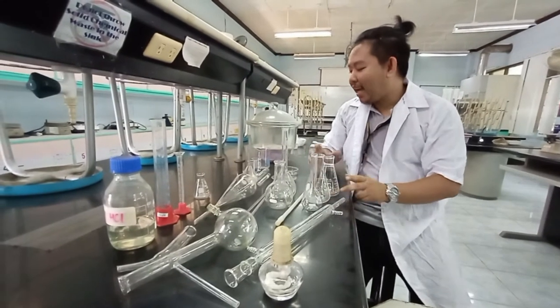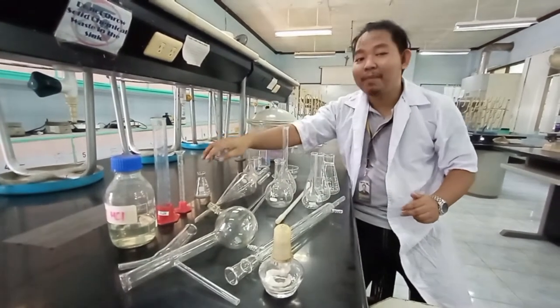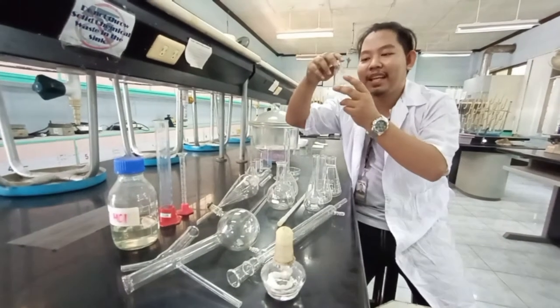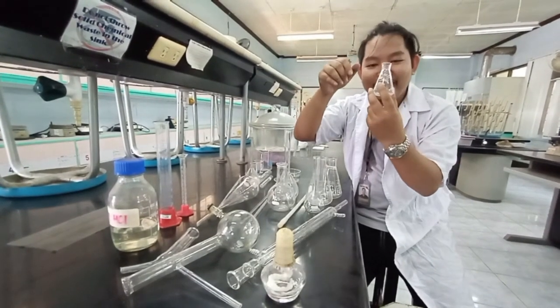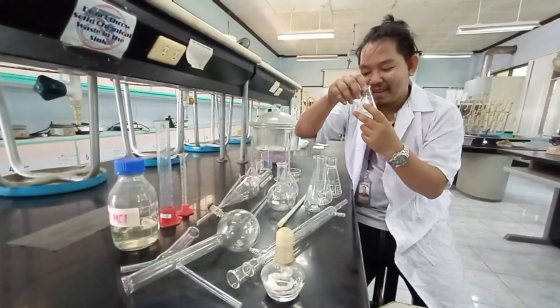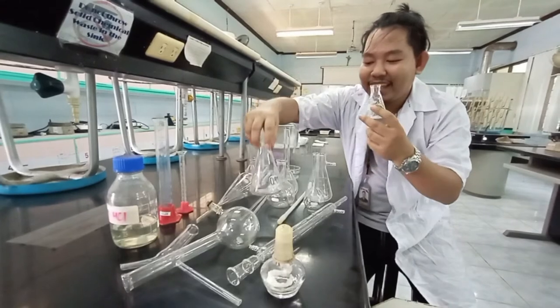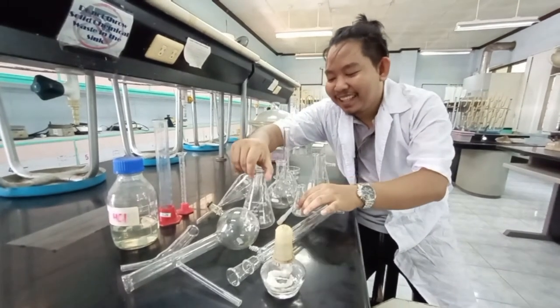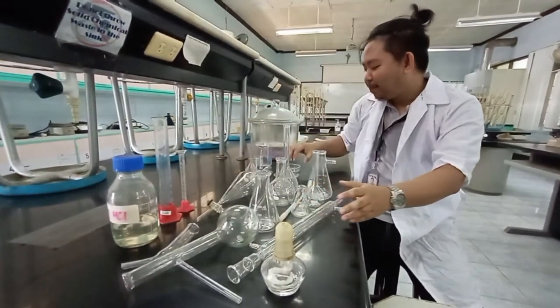Sometimes it can get confusing. And we also have a small, baby Erlenmeyer flask. So these are your Erlenmeyer flasks in different sizes.